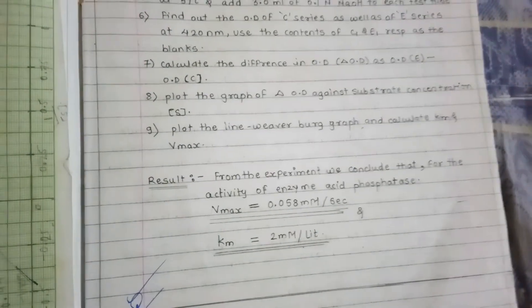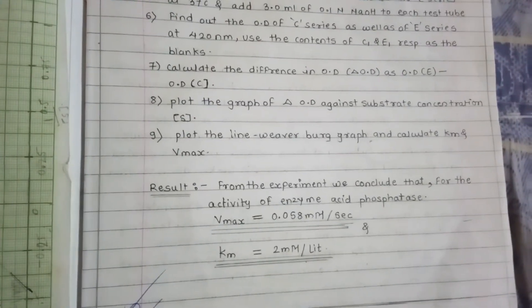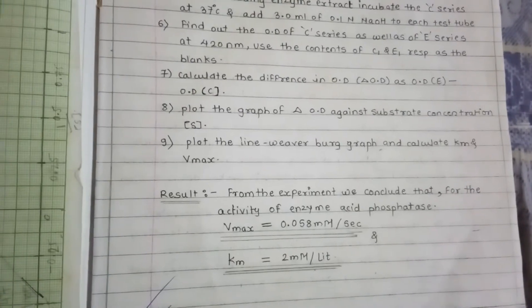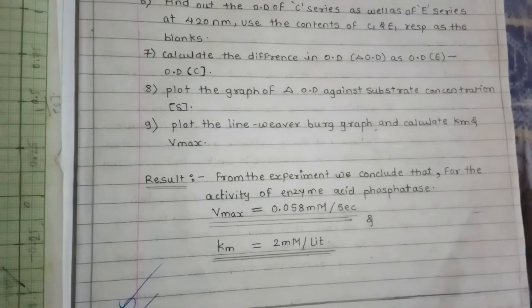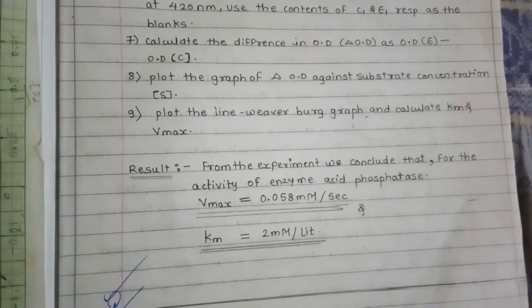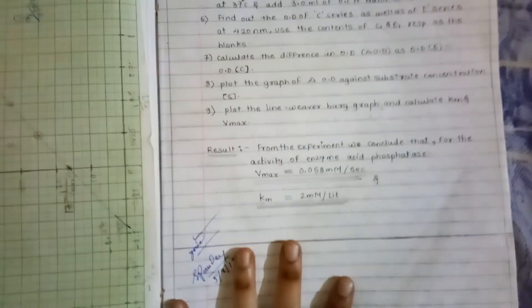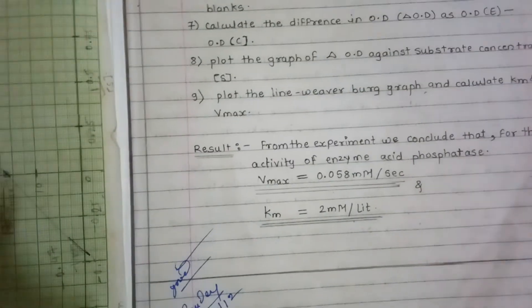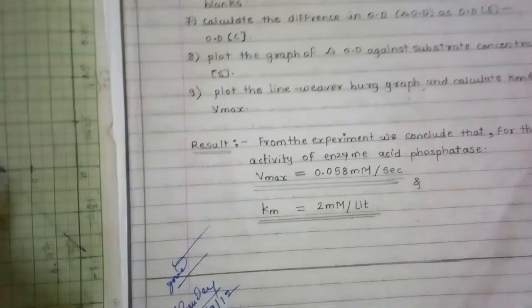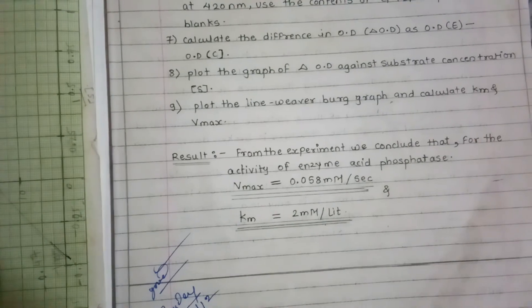In conclusion, for the activity of acid phosphatase, Vmax was found to be 0.058 millimoles per second and Km was 2 millimoles per liter. Key things to remember include: the aim, principle, how PNPP reacts with acid phosphatase to form para-nitrophenol, the enzyme category, its source, substrate used, units of Km and Vmax, and how to plot both the Lineweaver-Burk and Michaelis-Menten graphs.